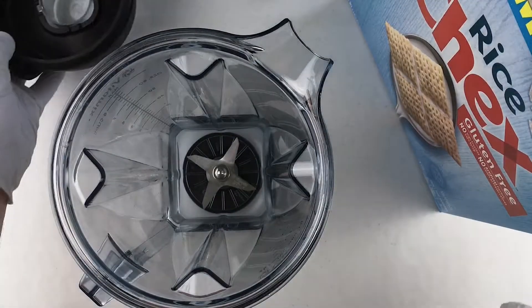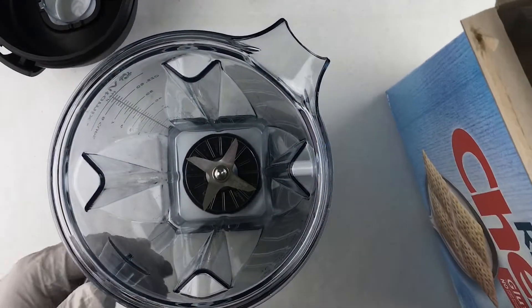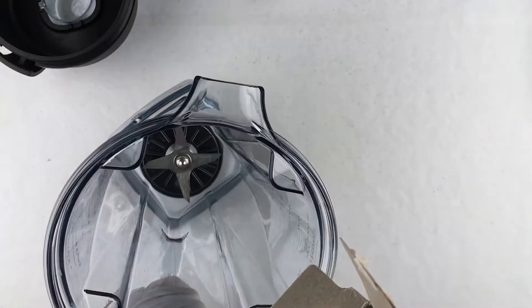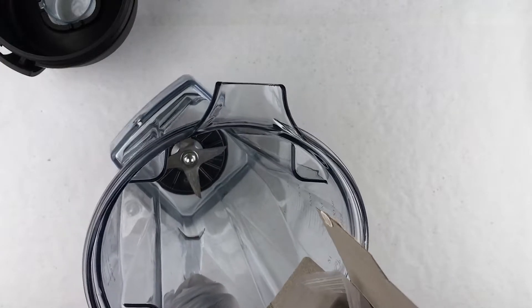So we're going to go ahead and give it a try and see how it looks. Got my blender here. I'm going to use this to grind up the sample so as to have a better chance that if there is any gluten in it, have a better chance of the test kit finding it and reporting it.